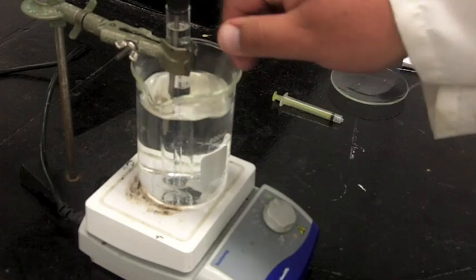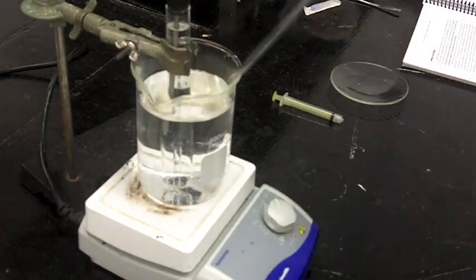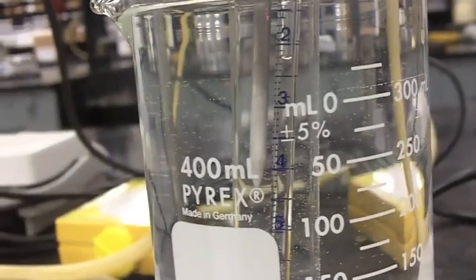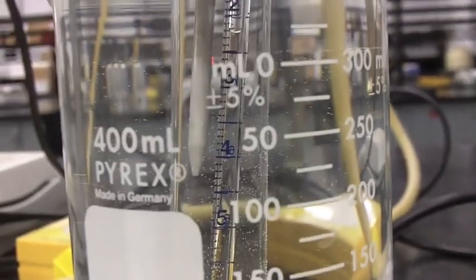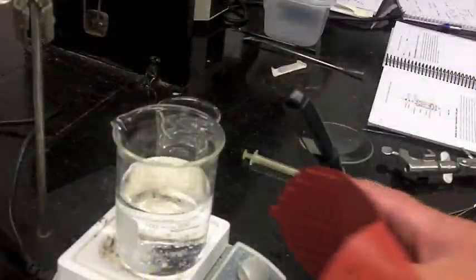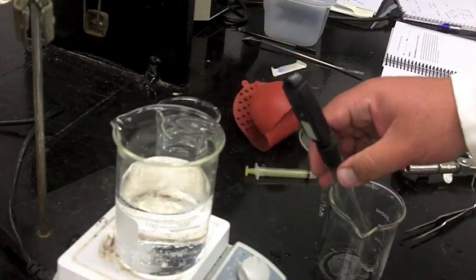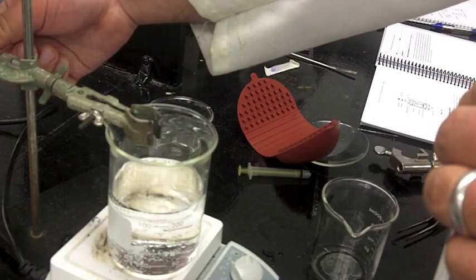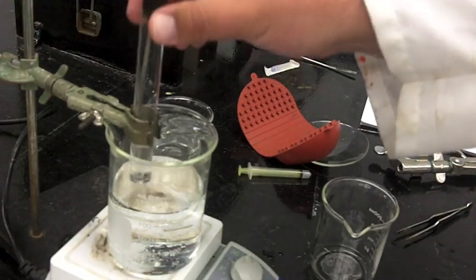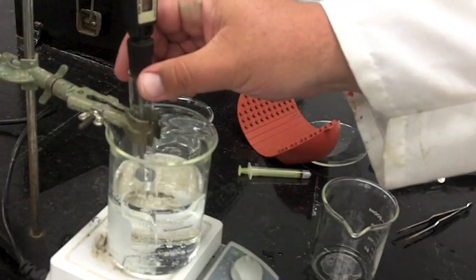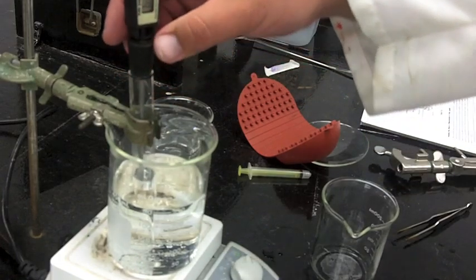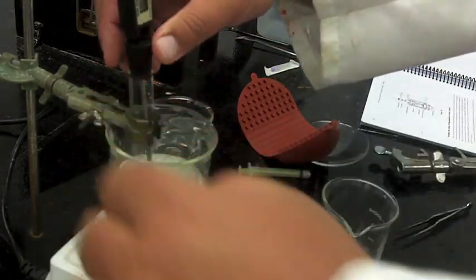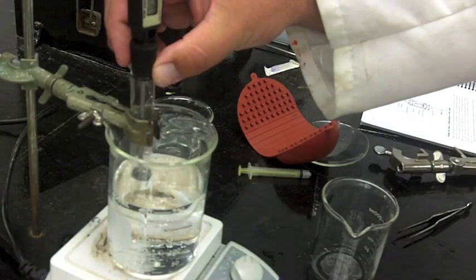We will stick that in upside down. You'll heat the water. You'll need to get about five different temperatures, typically somewhere between 25 and about 60 is good. At the end, finally we want to boil our liquid. You might have a thermometer above it where you can measure the boiling point. You want to wait till it comes to a stable temperature. You would really like it not to be in the liquid. We have some stoppers that might make life a little bit easier in terms of keeping it above the liquid level there.